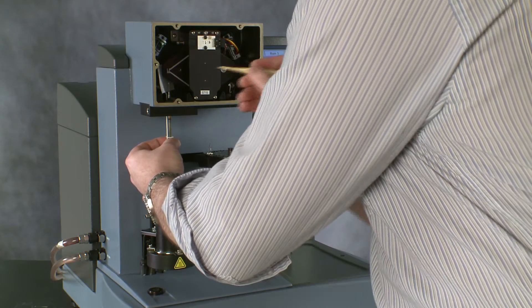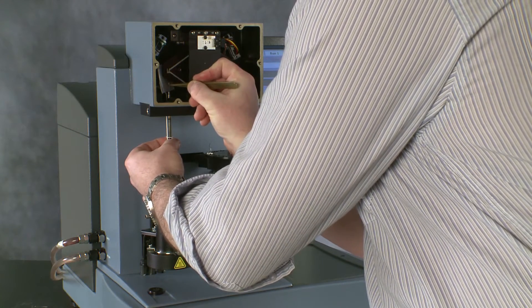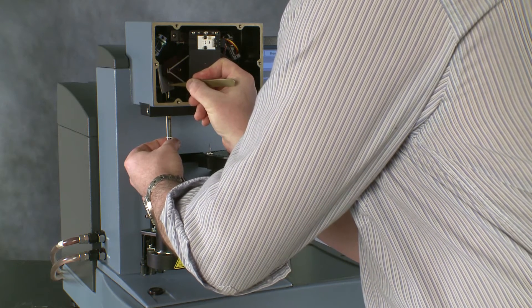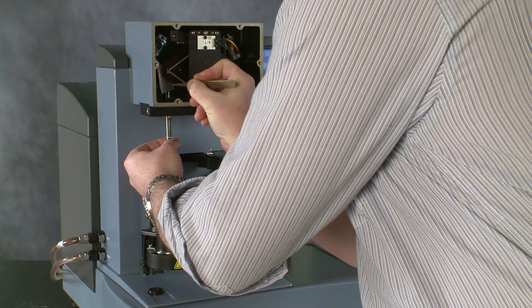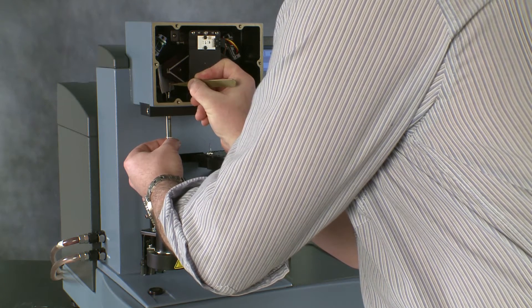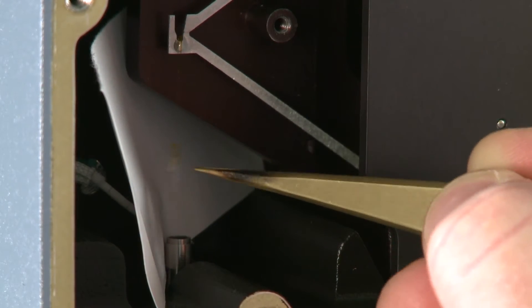Now, at the top, we can bring our Kapton coupling loop into contact with the top of our hang down wire and feed it through the small hole which is in the Kapton. This can be a bit fiddly, so just take your time doing it.